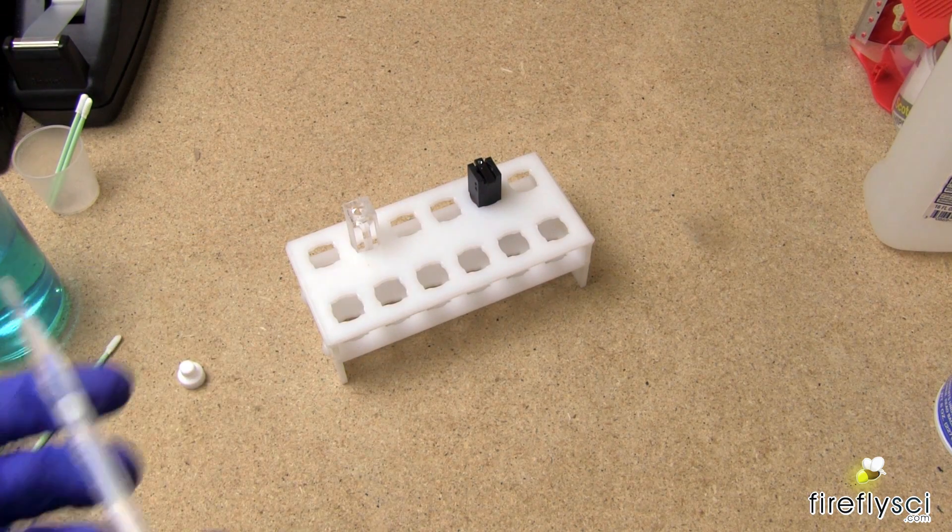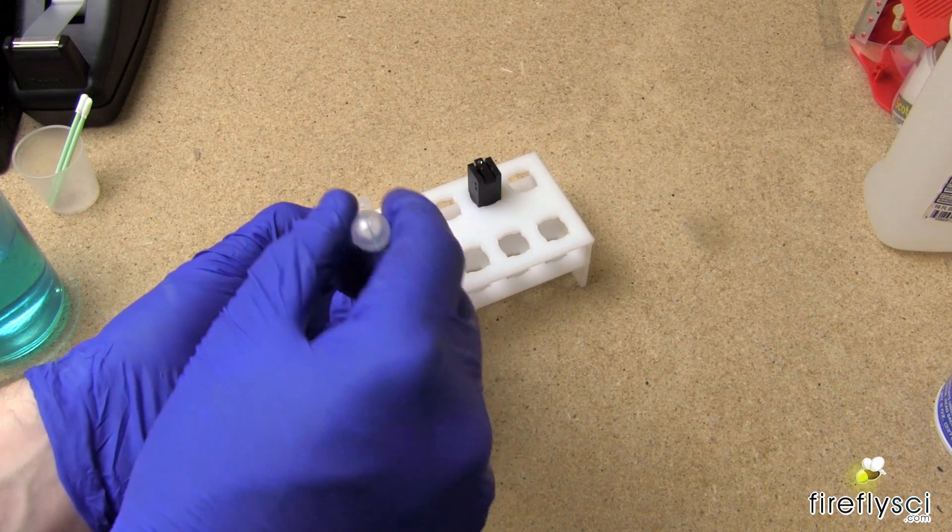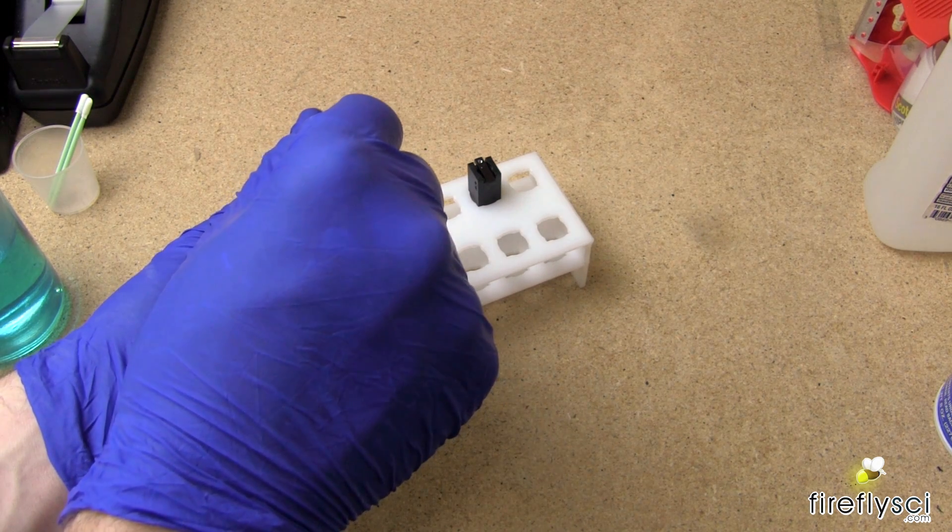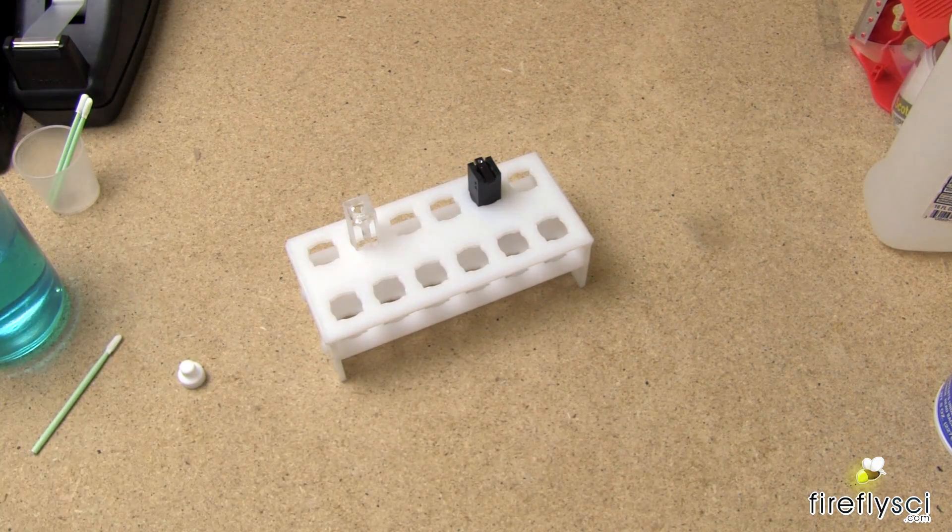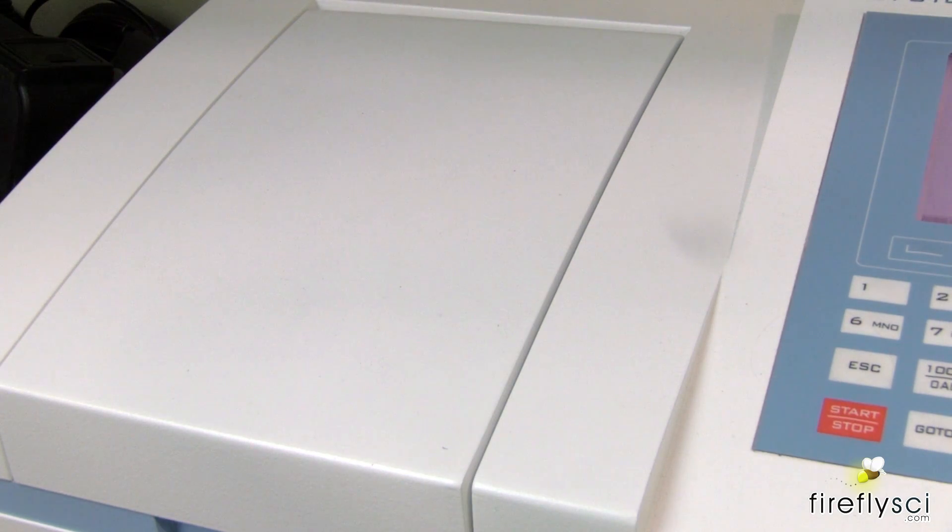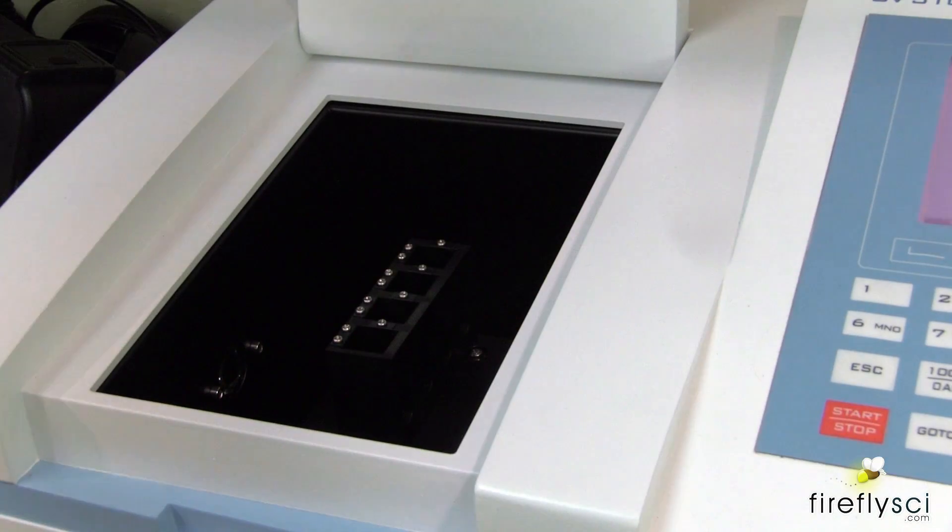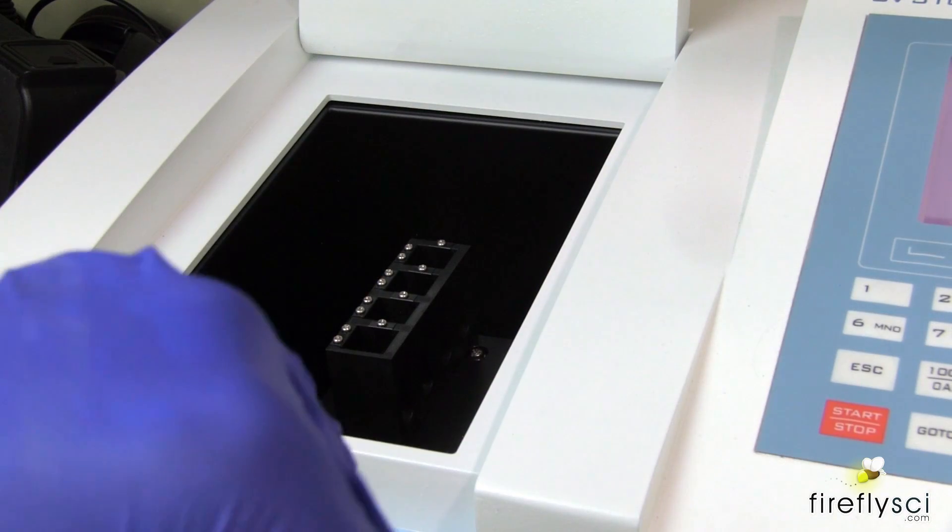And now I'm going to prepare our water blank for this experiment. So what I'll do now is insert the quartz cuvette filled with water into the sample holder, and now we'll zero the machine.